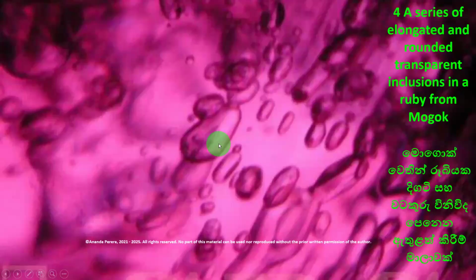We are moving to next. A series of elongated and rounded transparent inclusions. Look at those inclusions. All the inclusions here are transparent. We can see in between the inclusion. The backside we can see. So that is called transparent.